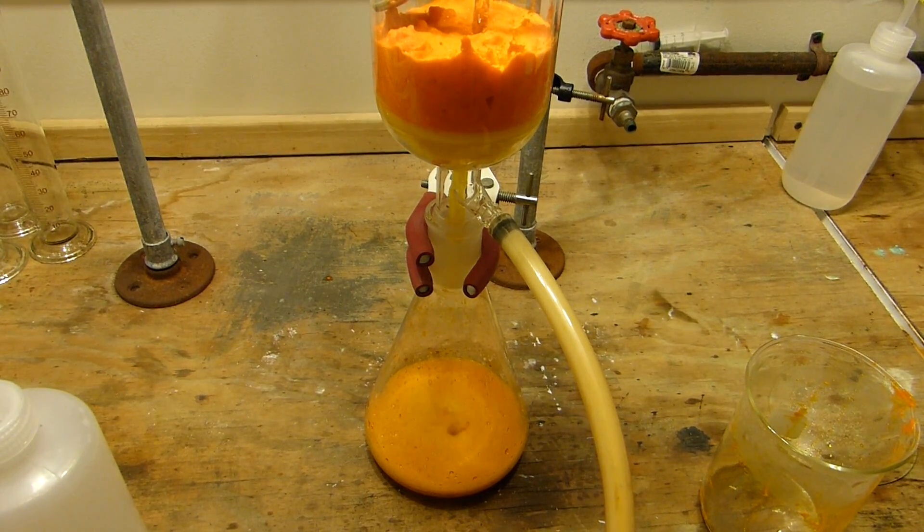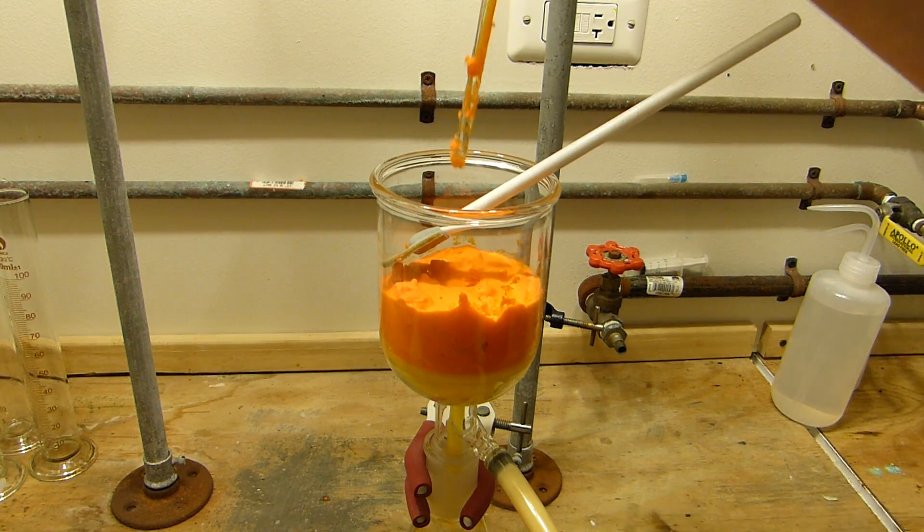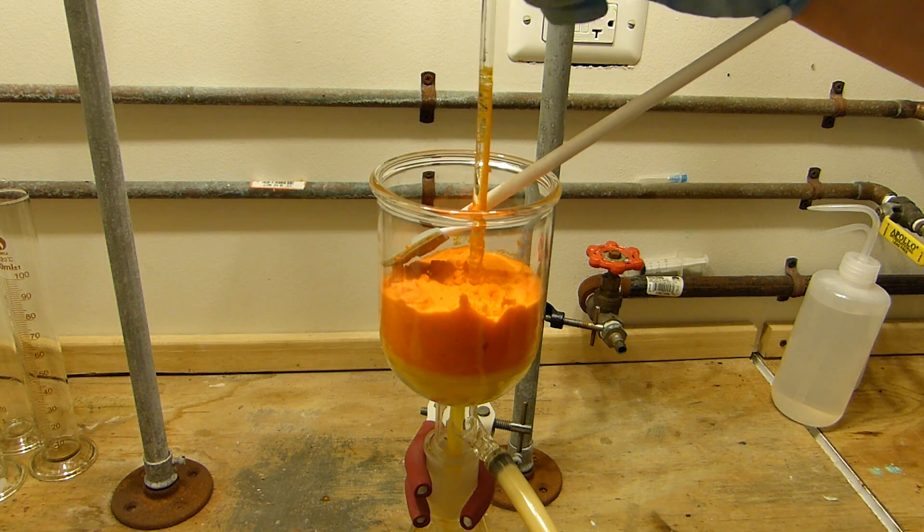Filter rather quickly. You can see that we're left with orange powdery solid up here.